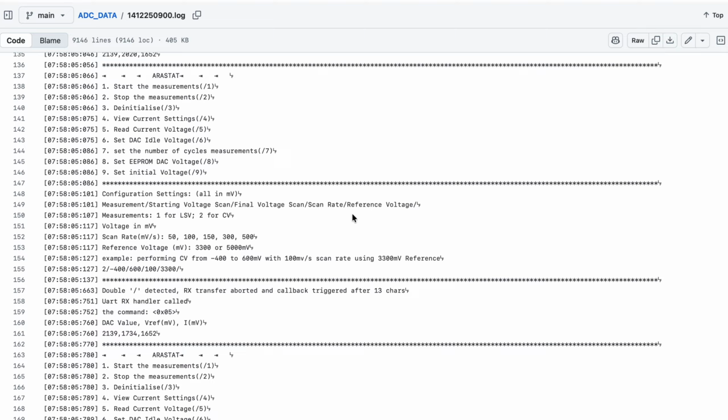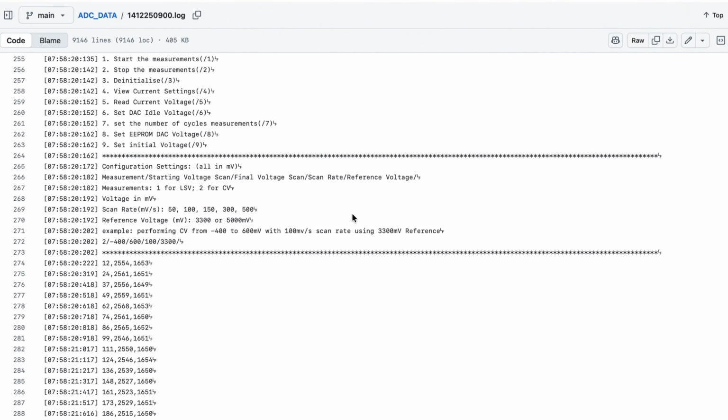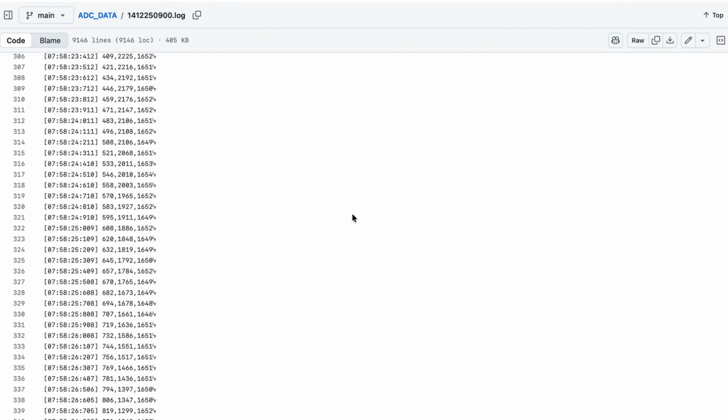This used to be our Potentiostat output. There is so much text and data. At this rate, we need to extract our data manually to visualize the measurement results.